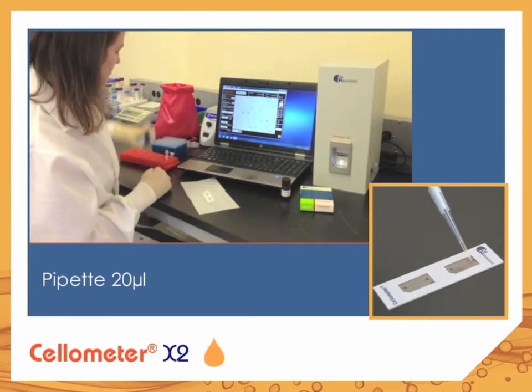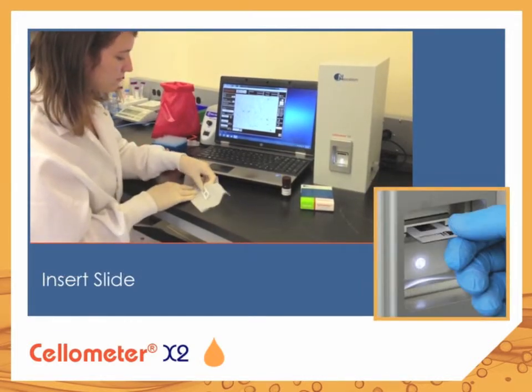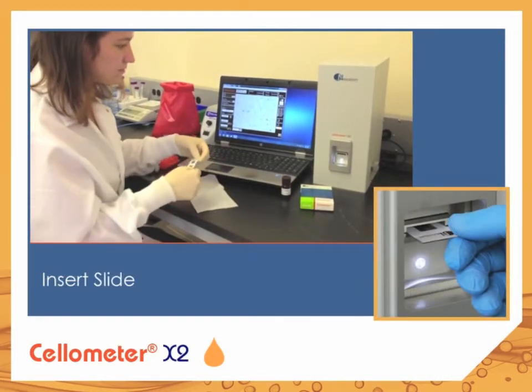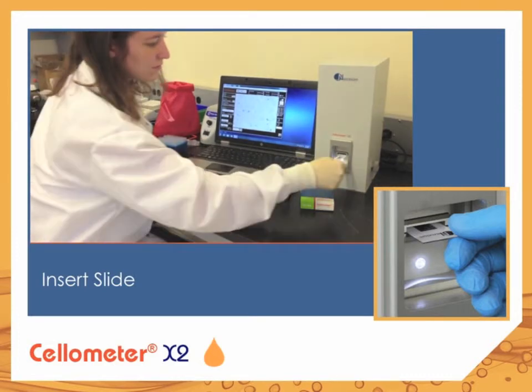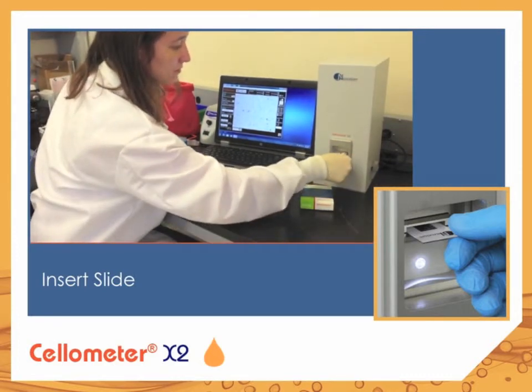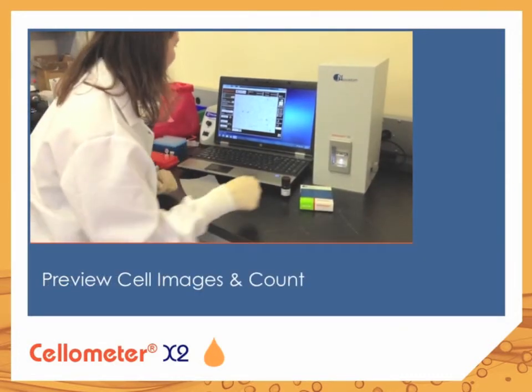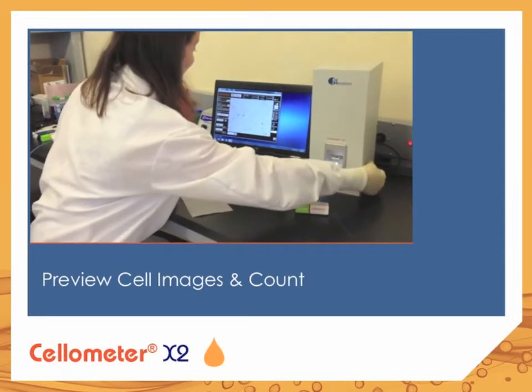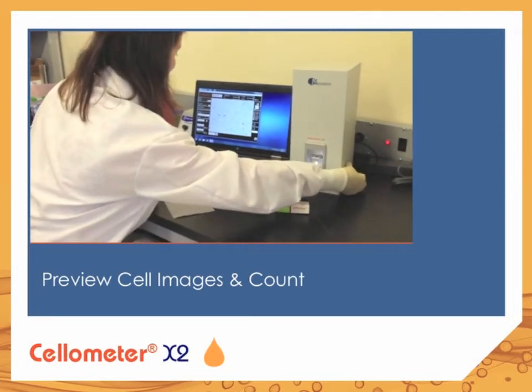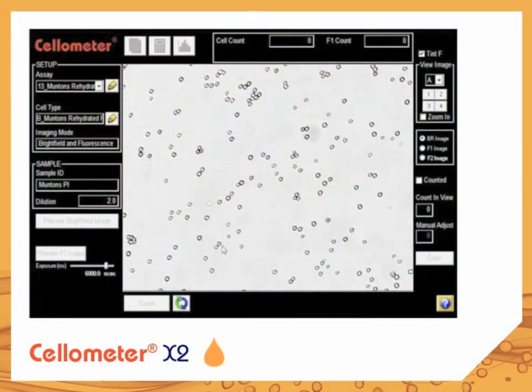Unlike manual counting with a hemocytometer, the counting chamber is loaded into the Cellometer X2, which replaces the user's eyes and microscope. Cell images are previewed and a click of a button starts cell counting.